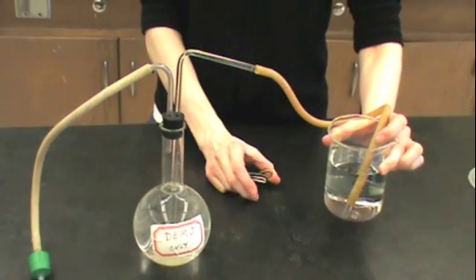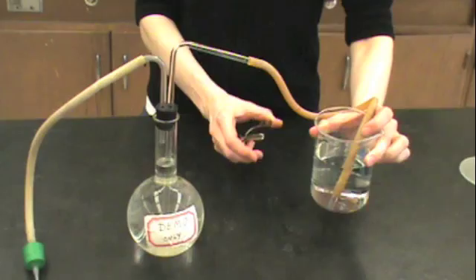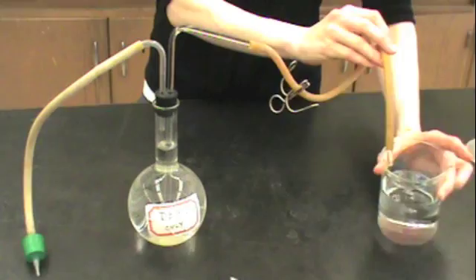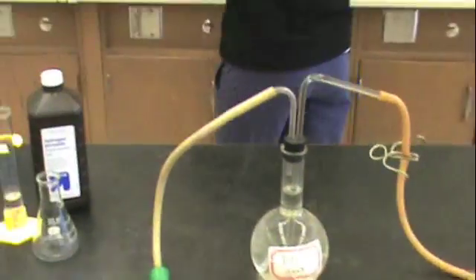This may take a few seconds. When the water level returns to the right place, secure the hose with a pinch clamp. Now you can empty the water from your beaker.